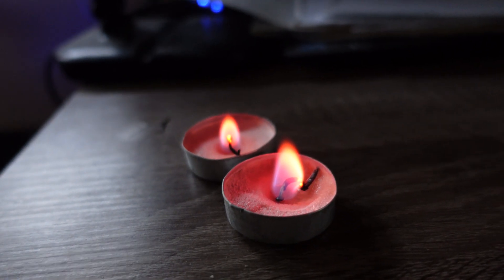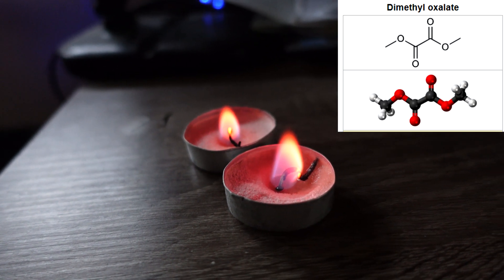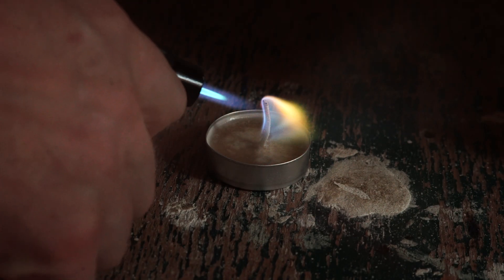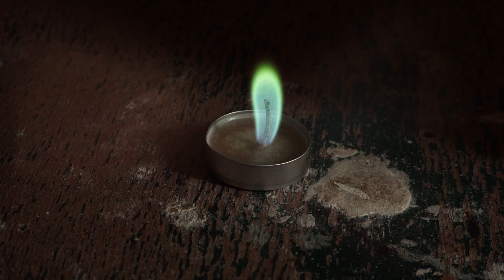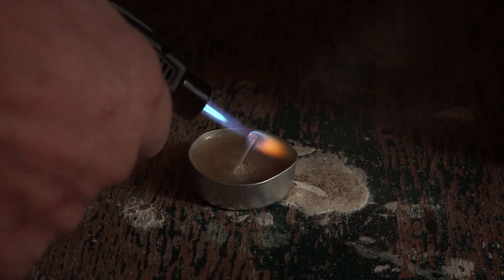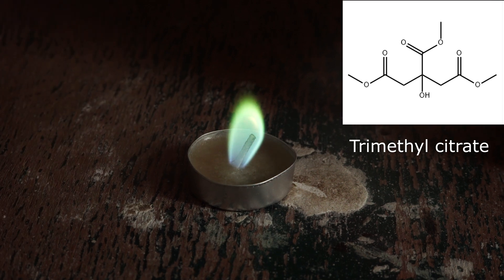That's pretty much it. In the previous video, I used dimethyl oxalate for the candle body because it's very easy to synthesize and it worked quite well, but it has one significant drawback — it sublimes at room temperature. A candle made from it substantially evaporates within a few weeks. Chinese colored flame candles usually use another substance, trimethyl citrate, with various technological additives.